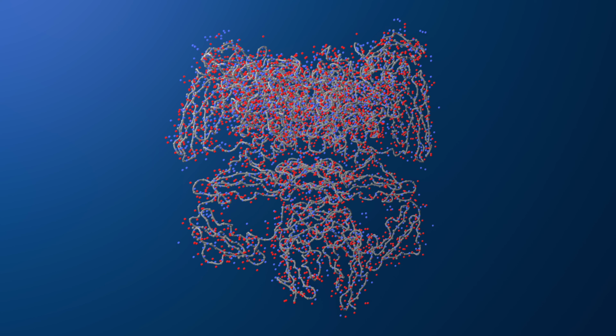To begin, you'll need to prepare your files. You'll need your Cryo-EM map of resolution up to 5 angstrom in either MRC or map format. In this example, we're going to model the structure of F420 reducing hydrogenase using DeepMainmast. This is EMD2513 and has a resolution of 3.36 angstroms. You will also need a FASTA file containing the amino acid sequence of your protein, and optionally you can upload an AlphaFold model in PDB format for better accuracy.